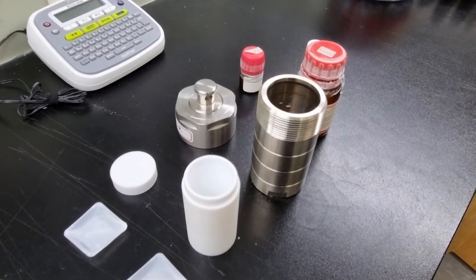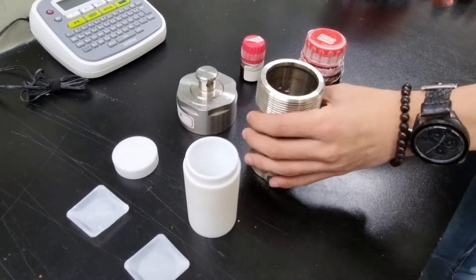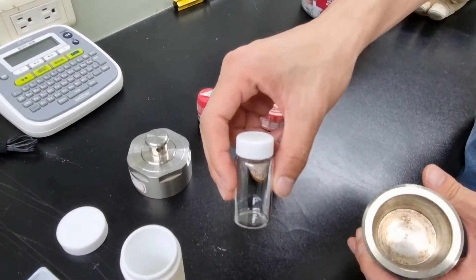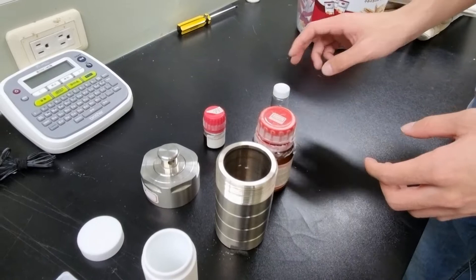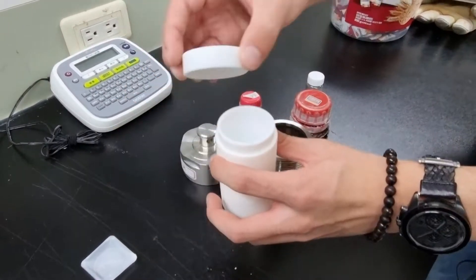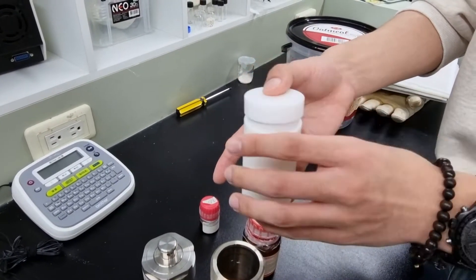For those of you who selected the synthesis procedure requiring high temperatures, you should use this teflon-lined autoclave instead of using this vial, since the vial has the possibility to either explode under high pressure and temperature. The process to using it is simple. First, you have to find this teflon-lined autoclave, also with a cap.